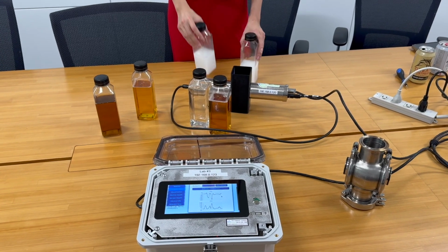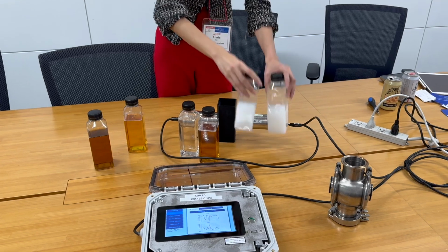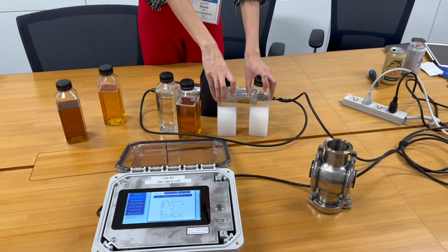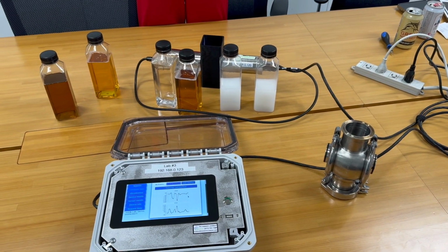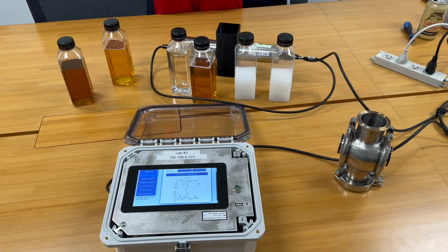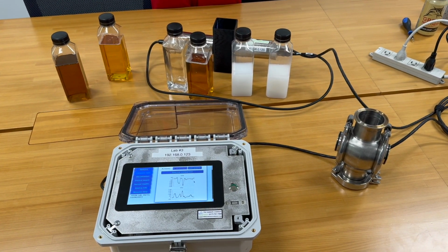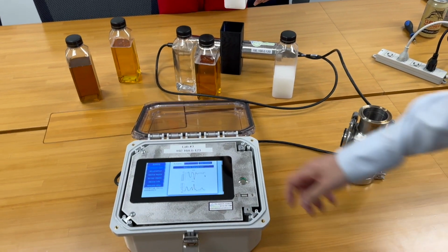So what we can do is distinguish the difference between two of the same products, different fragrances, to see in real time, okay, we're reaching good quality of this new batch, this new product. We can send this to the filler instead of sending this to waste, reducing our waste and our product loss and improving line efficiency. So I'll actually show you, if we can clear that baseline.